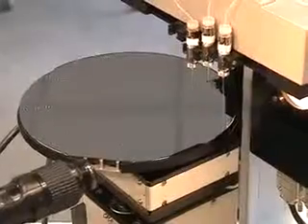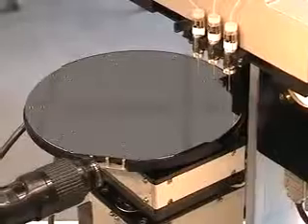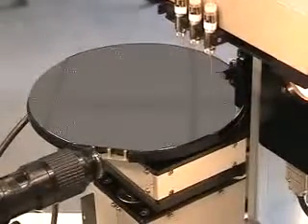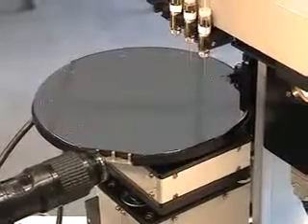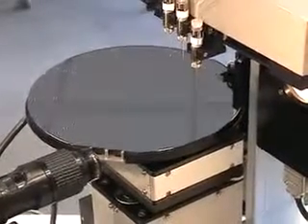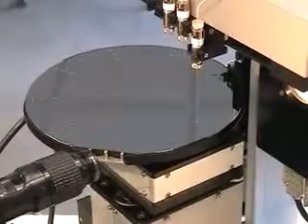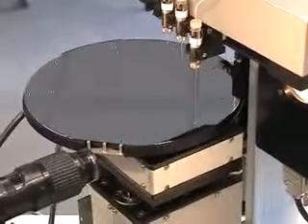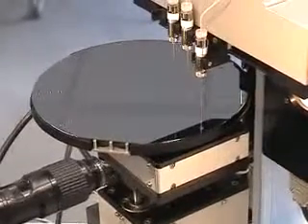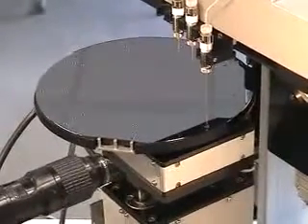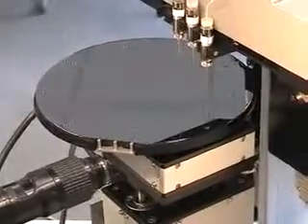So we can click through all the Excel data, where we see all the results which we have collected meanwhile. So the last position will be measured now. The drops will be produced on the fly and then deposited here on the wafer.